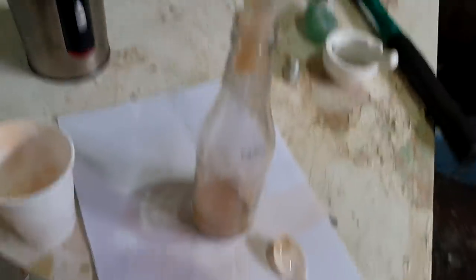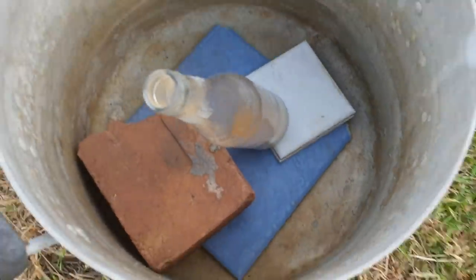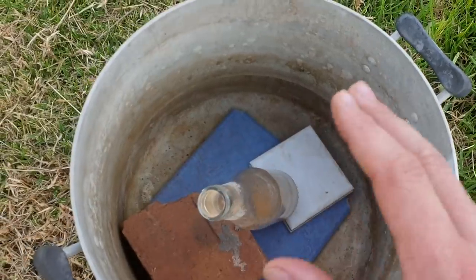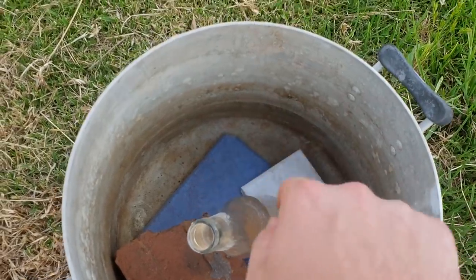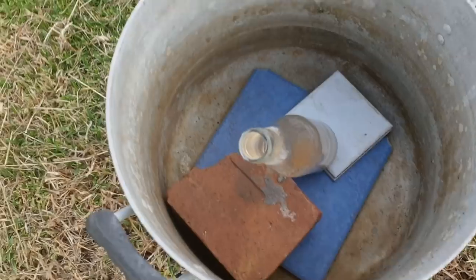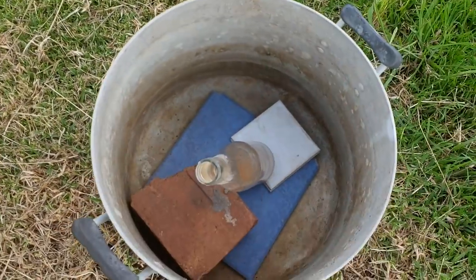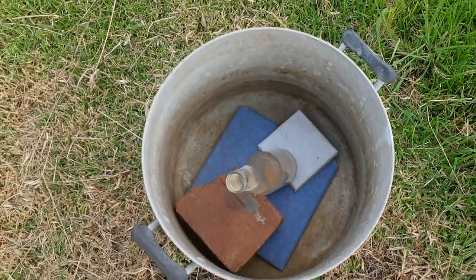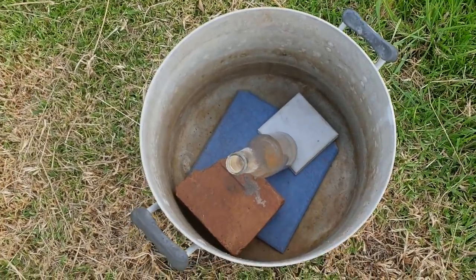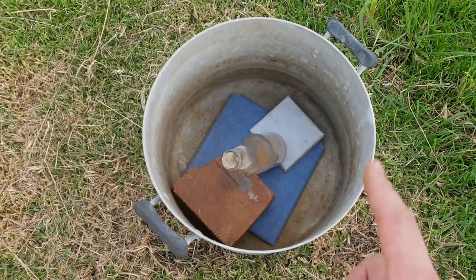I'm not very convinced by this reaction vessel shape. So we've got the mix in here — it's off-axis because I don't want it to be as spread out. I want it to have some depth to it, so putting it on that angle makes that triangular bit have more depth. It's in secondary containment so even if it sprays stuff everywhere I can put the lid on. It's not going to go anywhere and we're not going to cause any fires — there's been enough of that around here lately. It's not what I need on a 40 degree day.